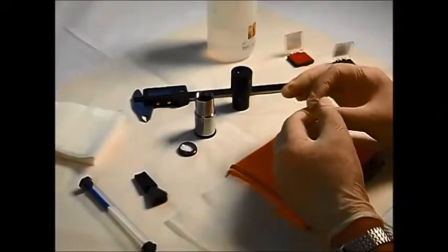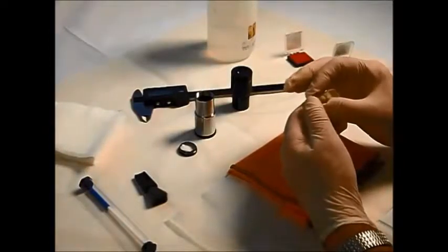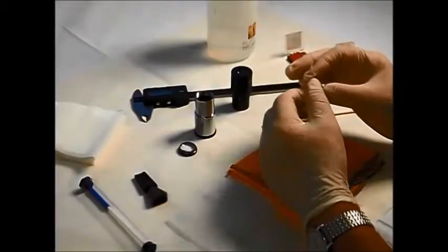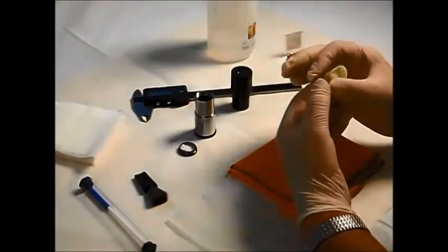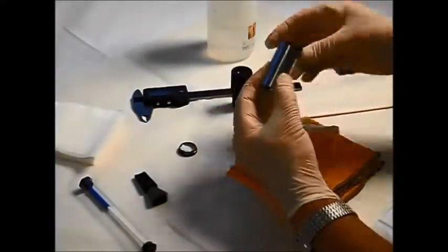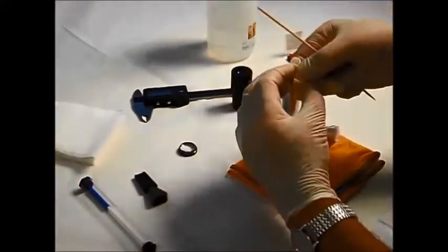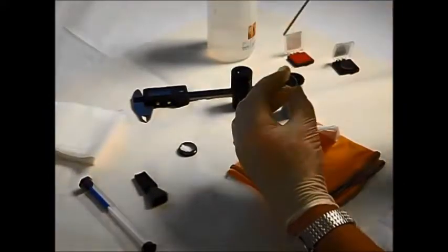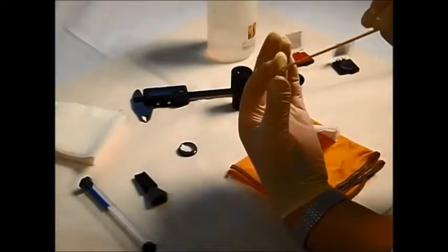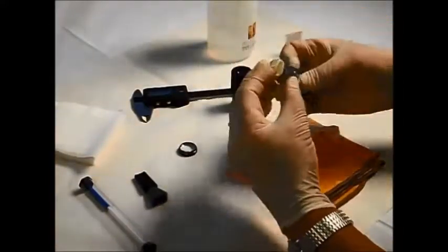Now, a reticle has two sides. The orientation of the reticle can be difficult to see while it's out of the eyepiece. If we get this the wrong way round, when you look through the eyepiece, any text or numbers are going to be the wrong way round. The way that it's intended for use is that you look through the eyepiece from this side down through the microscope, and similarly through the eyepiece reticle to the side which has the chrome image on. So you're looking through the glass to see the chrome image. So we need to assemble it with the chrome image on the downside.